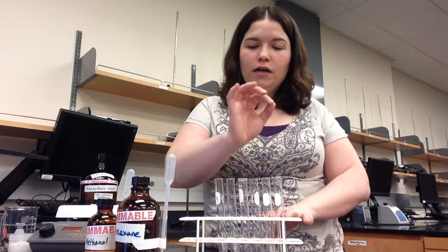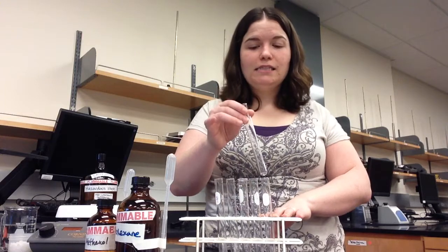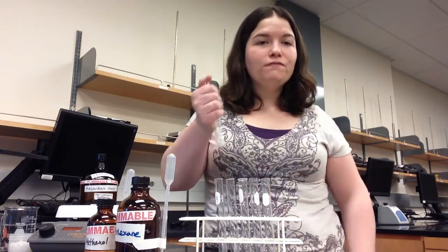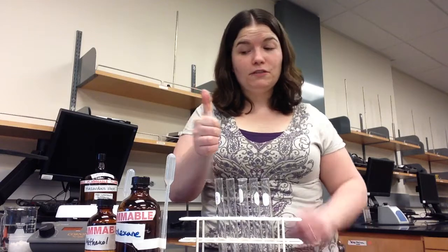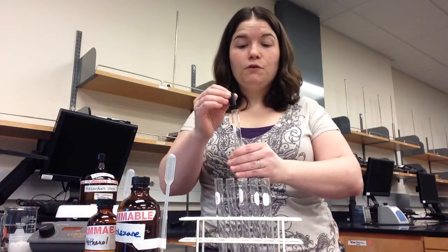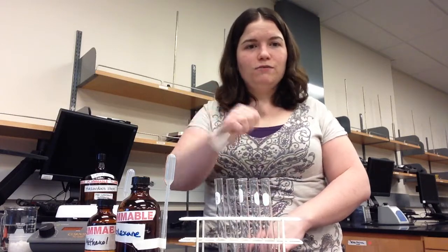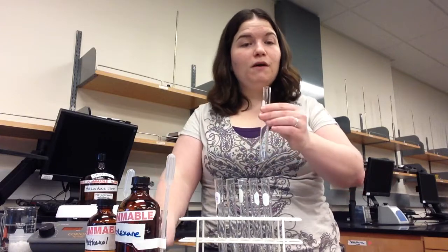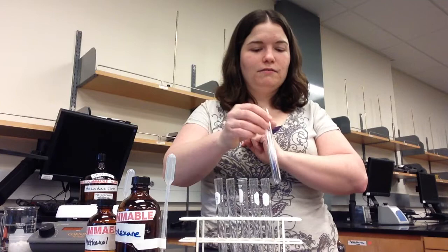Once you have added your unknown and the solvent, you're going to need to shake this test tube to determine if the substance is soluble or not. Do not put your finger on the end of the test tube and shake it up, because this will get solutions or substances on your fingers, and it may be harmful to your skin. You have two options. You can use the black corks that are on the lab cart to shake it this way to see if your substances dissolve or not. Or you can leave the test tube uncorked and just shake it gently, trying not to splash the liquid out of the test tube.